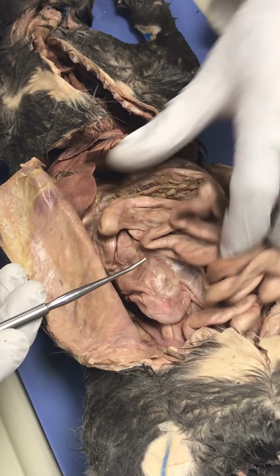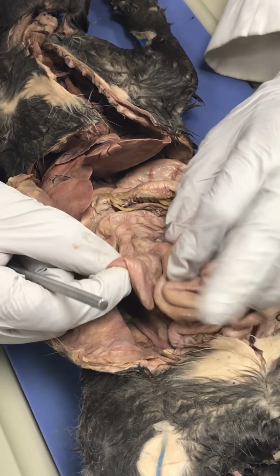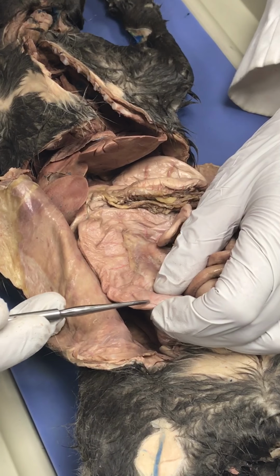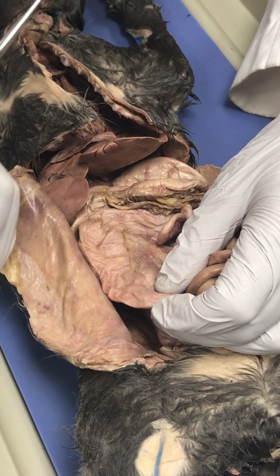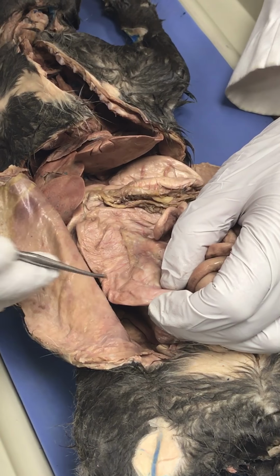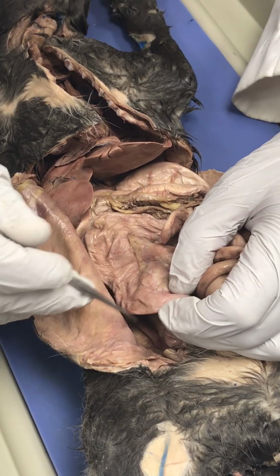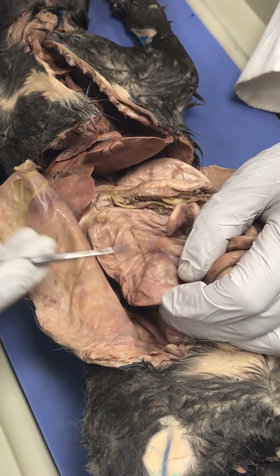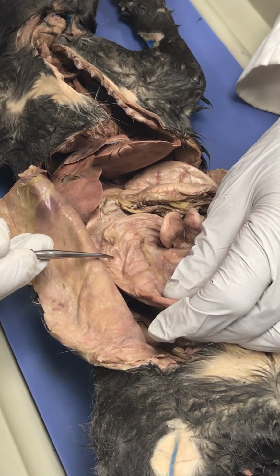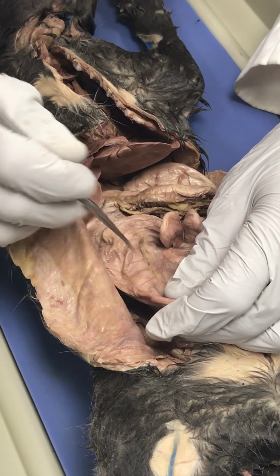And so this cat is different from the other cat, and I pointed that out because this cat has an ascending colon. The other cat that we were just looking at, I would almost swear that the cecum starts up here. You think so? Yeah. It was way higher up, and this one really comes up. The other one is barely noticeable, but they do curve very, very quickly.